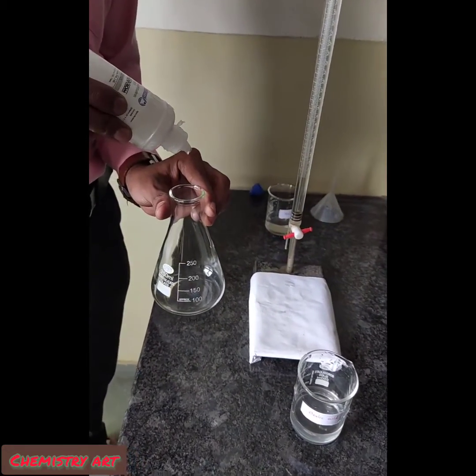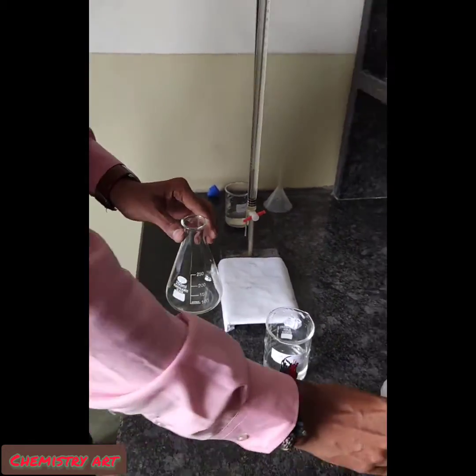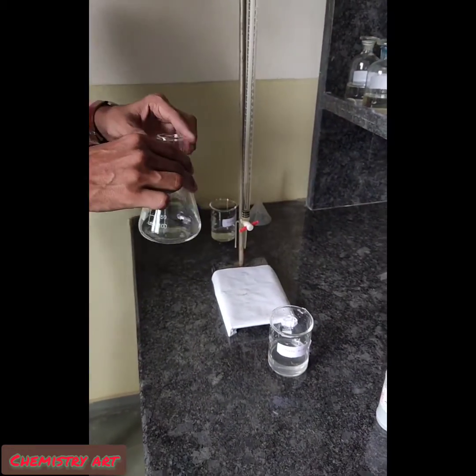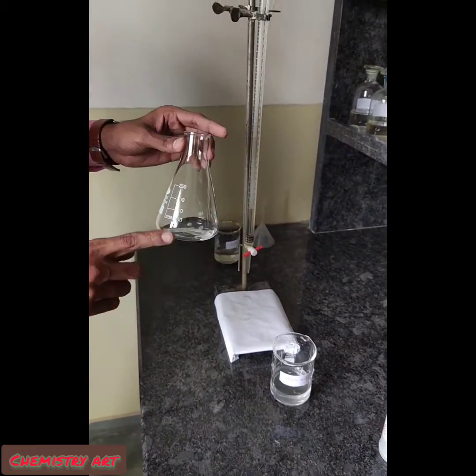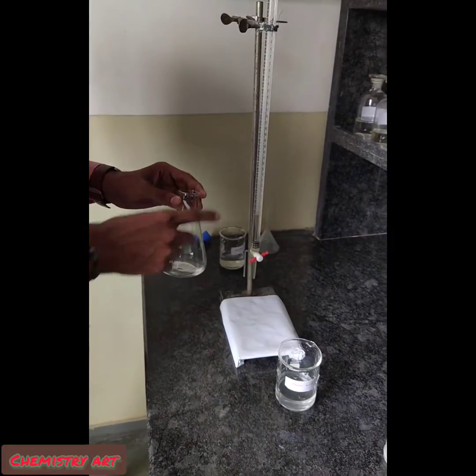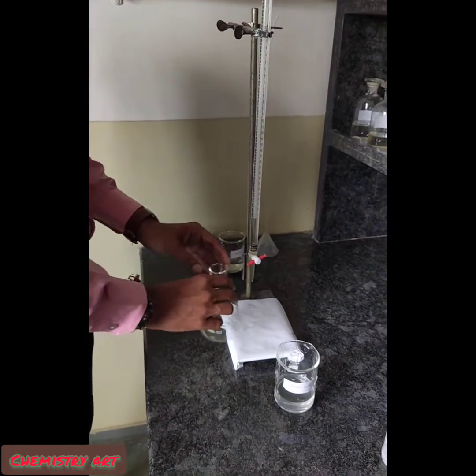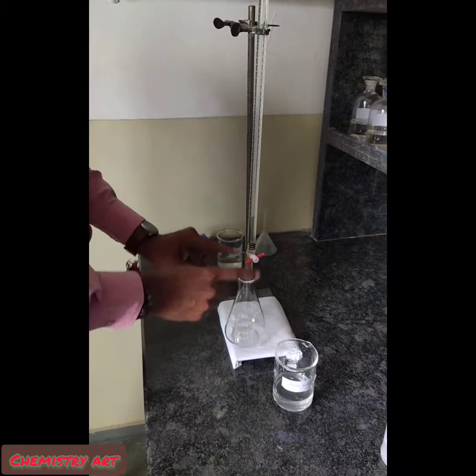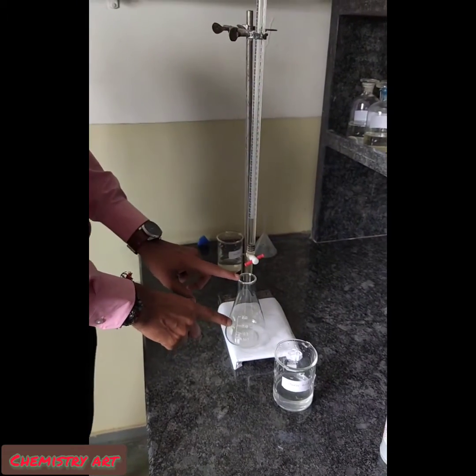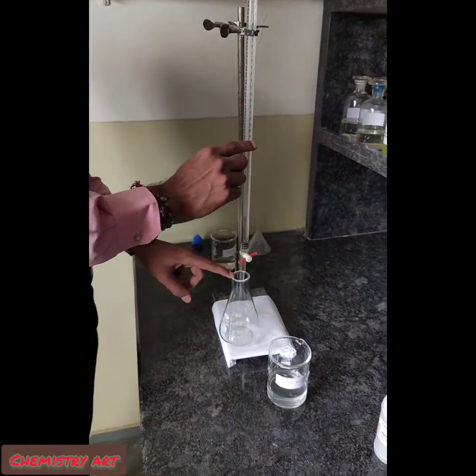As the solution becomes basic, phenolphthalein will show a light pink color. So this is our 10 ml of oxalic acid with phenolphthalein indicator. Now we will add NaOH into the oxalic acid to titrate and neutralize it.